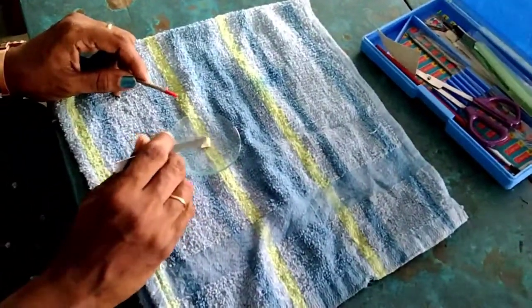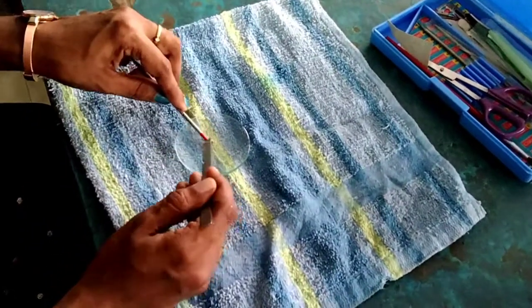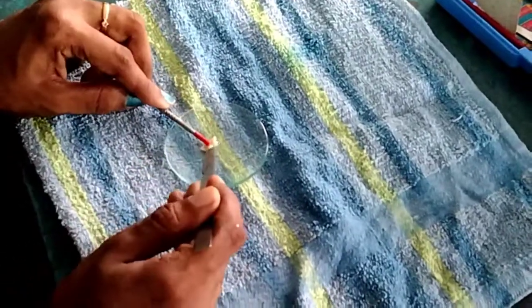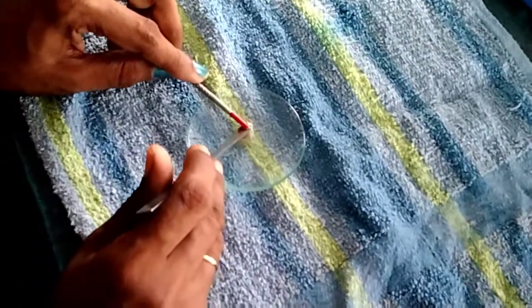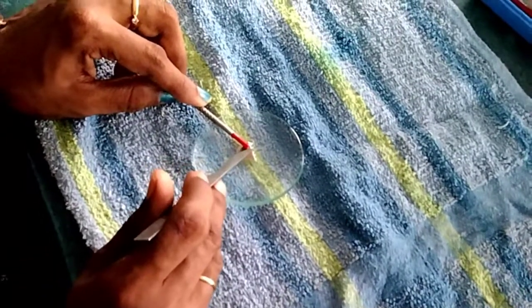This is the skin of shark, scoliodon. This is a small piece of skin of the shark. In this part there will be the scales. This is the outer part, the surface of the skin, and here there will be the placoid scales.